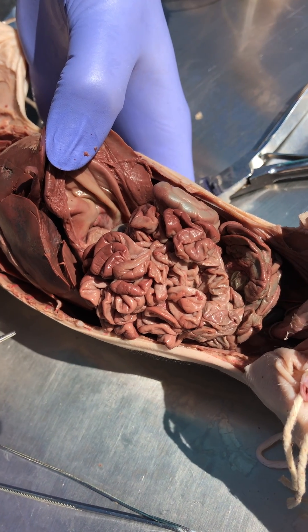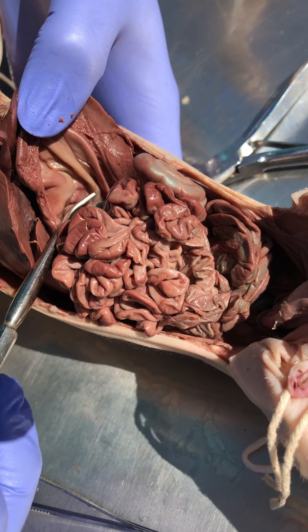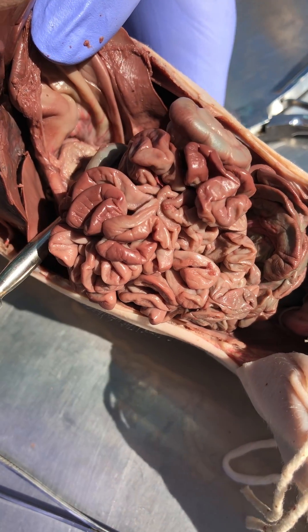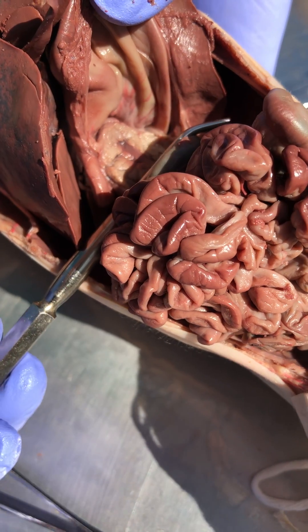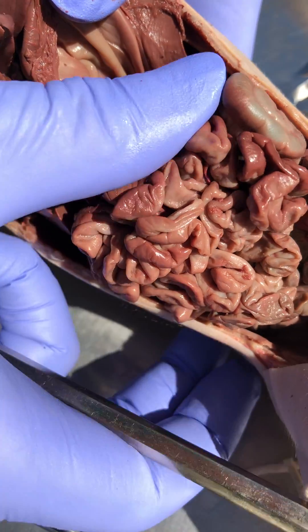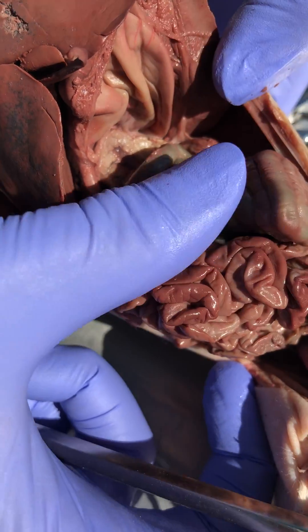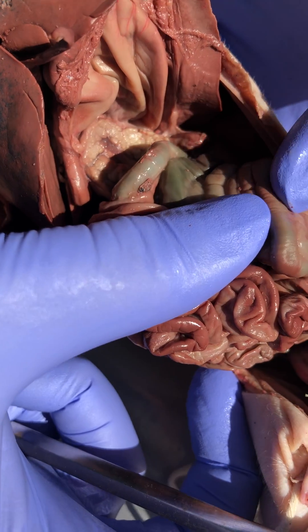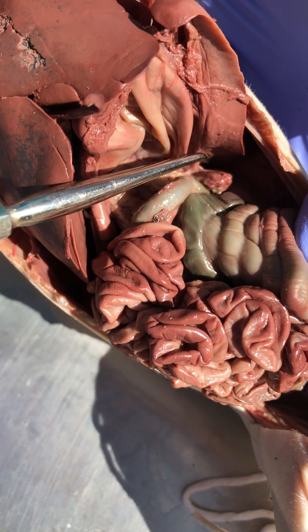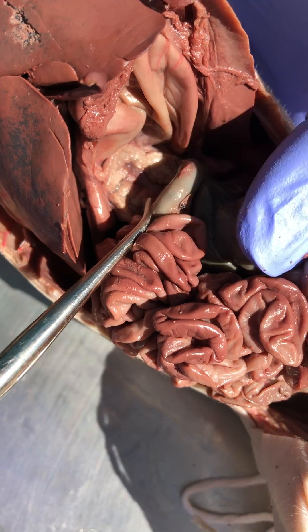The pancreas is usually embedded in a lot of membrane, but that membrane's been dissected away. See that cottage cheese looking stuff down there — that's the pancreas. Let me pull some stuff back so it's less shadowy. This is the dorsal lobe of the pancreas, the tail — all that cottage cheesy looking stuff.